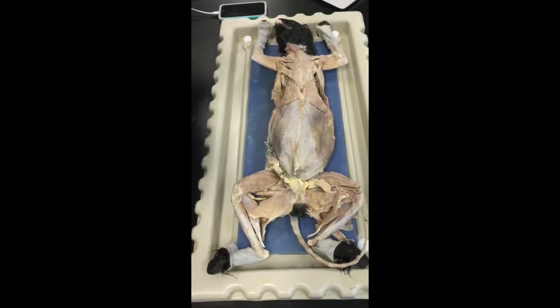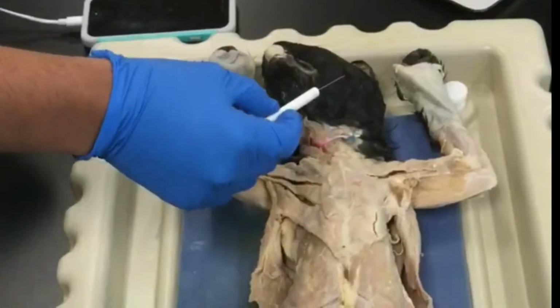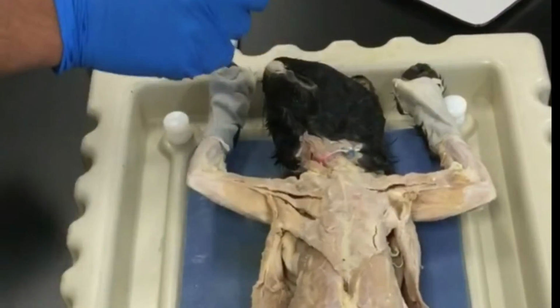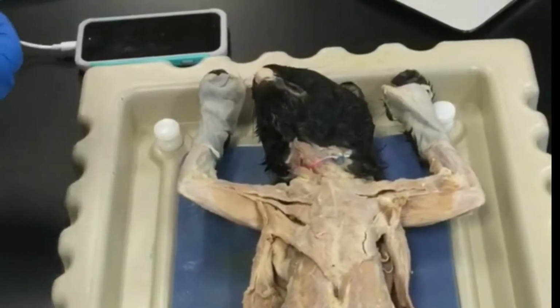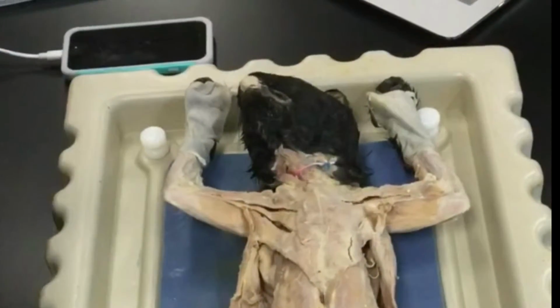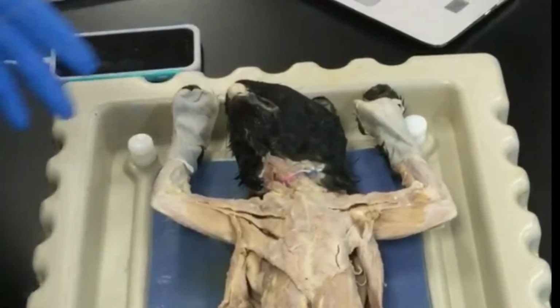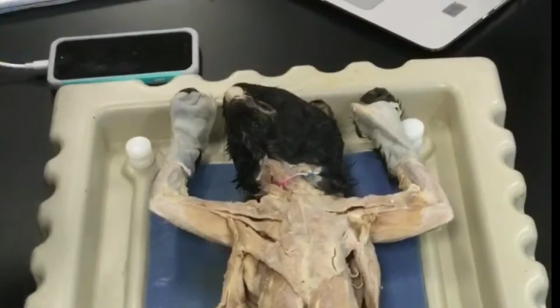Cat dissection 101. We're going to start off with the integumentary system. This is the fur. It provides warmth, protection, and it also is used for communication when it puffs and bristles. Some of the special adaptations that the fur has would be that the skin regenerates and fights off infection. When the cat feels threatened, it tends to bristle up and make itself bigger by making the hair on its back stand up.